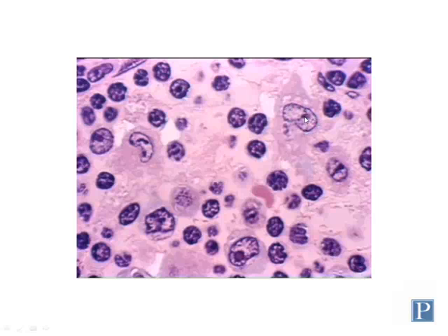And you can see their nucleoli. The rest of the nucleoplasm is quite pale. So this entire structure here is a nucleus, not a cell. The nuclei of macrophages are often so large that they're frequently confused with entire cells. Many macrophages have multiple nuclei as well.